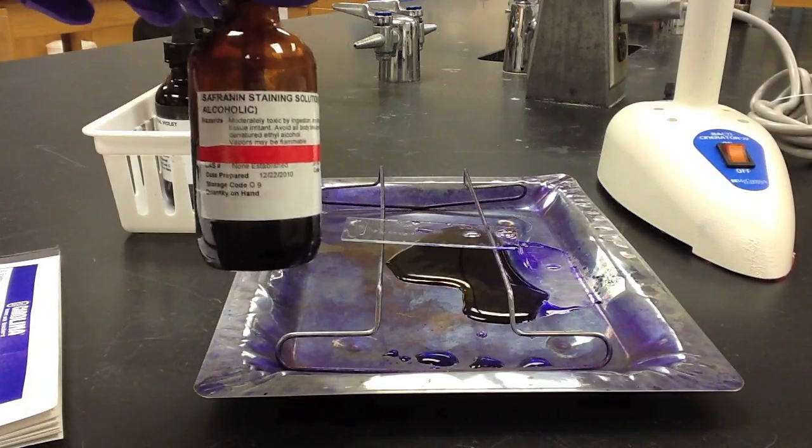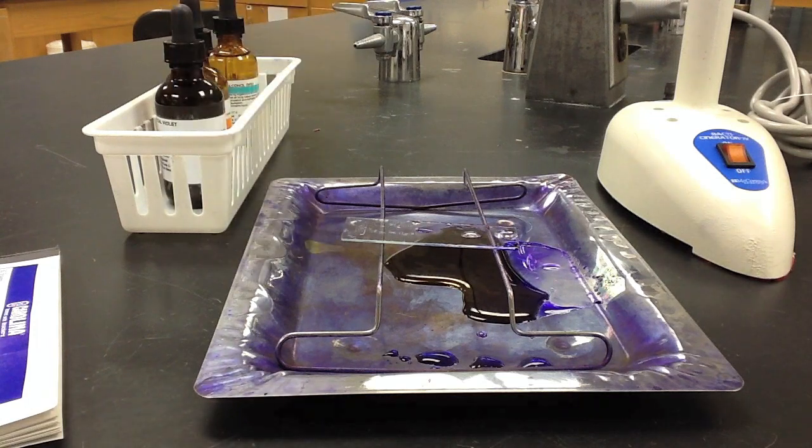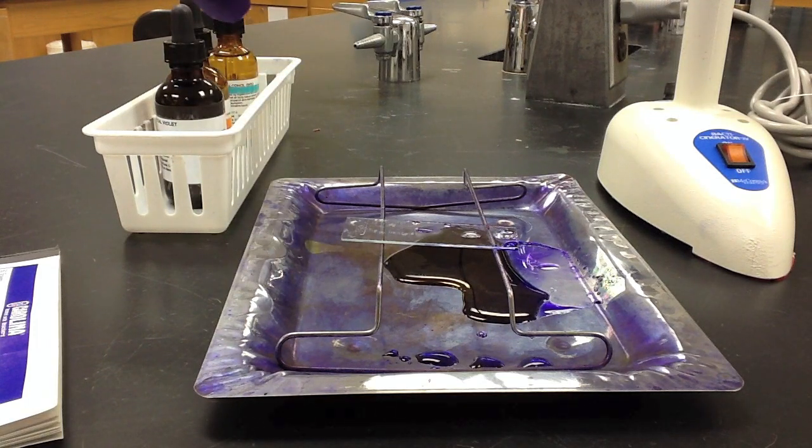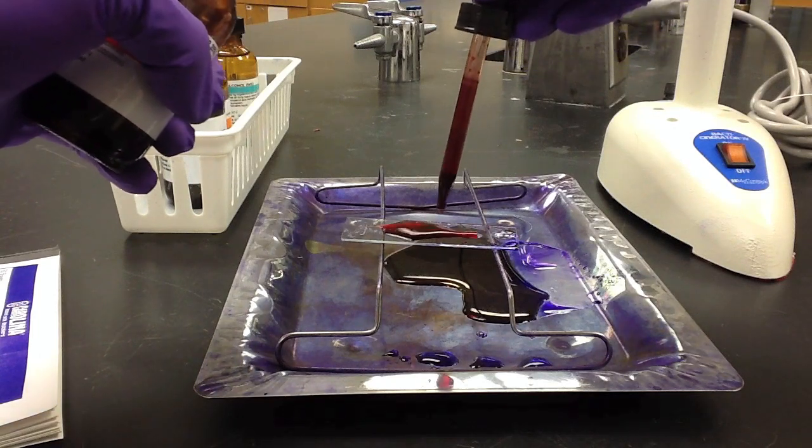For the final step, we'll add counterstain, called safranin, to the surface of the slide. We once again cover the entire sample with safranin and allow it to incubate at room temperature for one to two minutes.